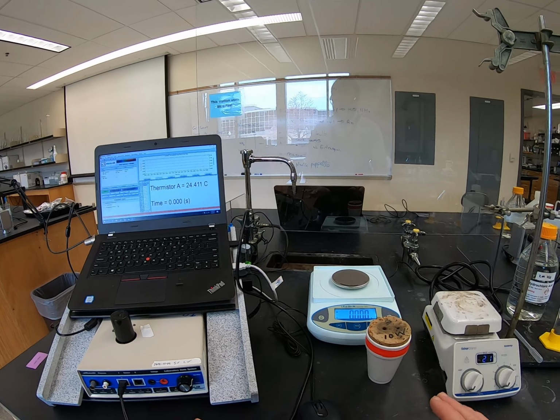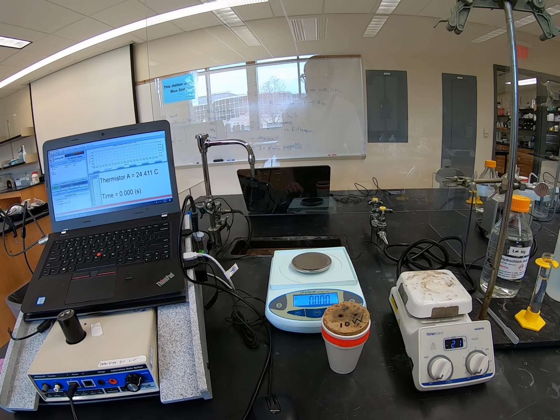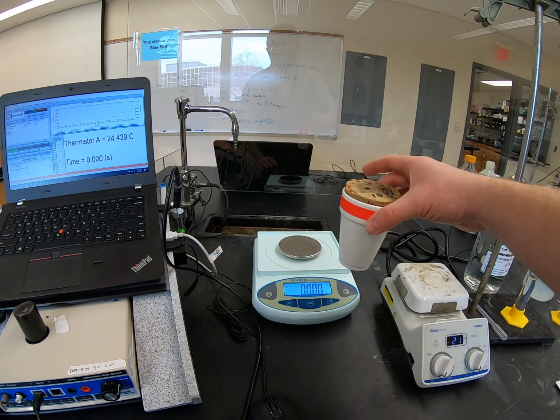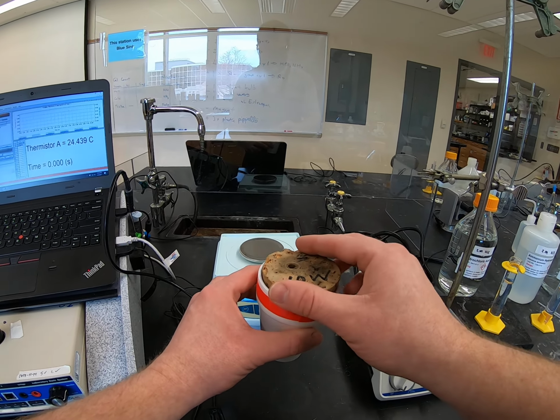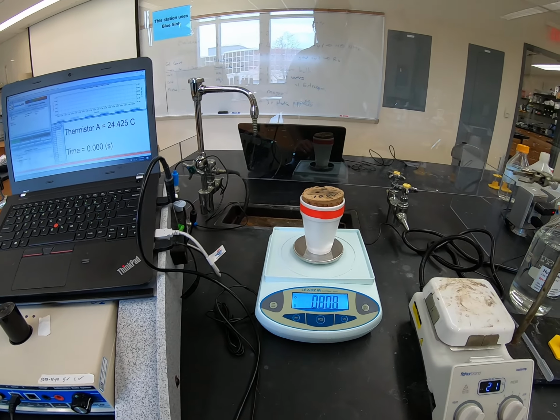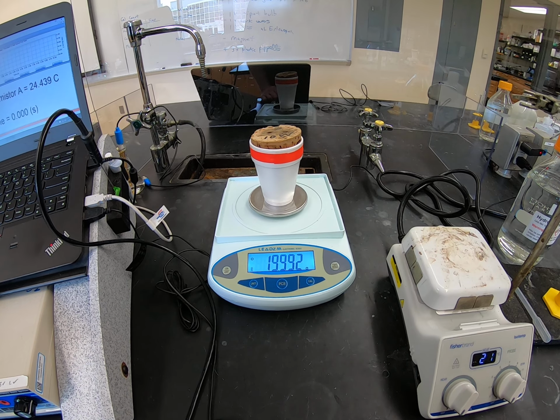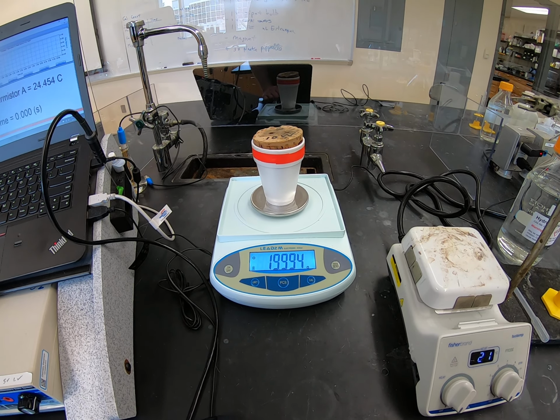FYI, this video and the following video are going to be a fair amount faster because I explained a lot of what was going on during video number 1. Okay, so we've got our empty calorimeter. So calorimeter, nothing in it except the stir bar. Okay, boom. We're actually going to find the initial mass first this time. So here is our mass of calorimeter and stir bar that is empty.